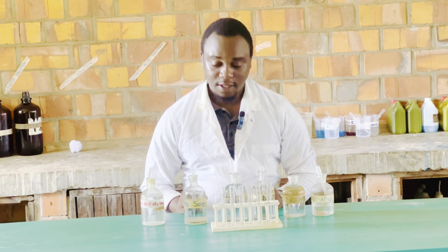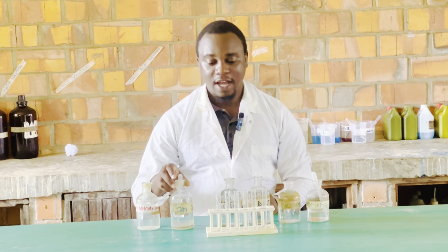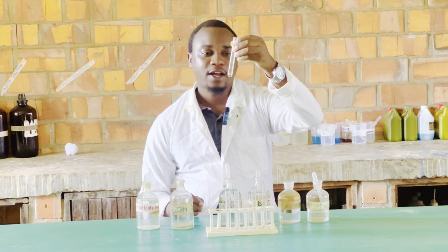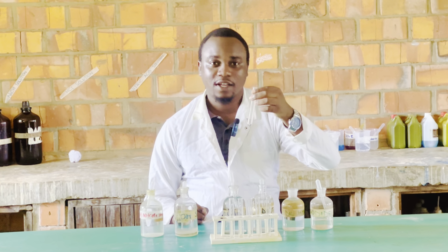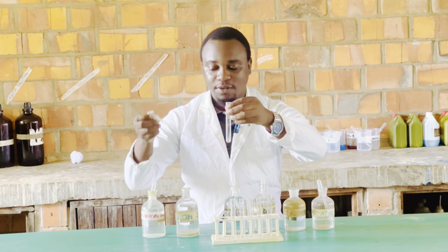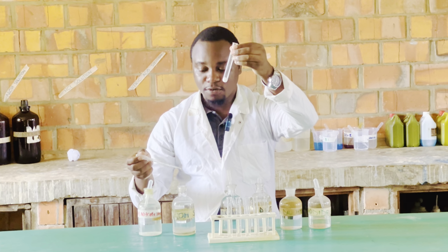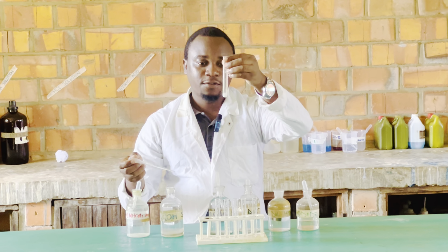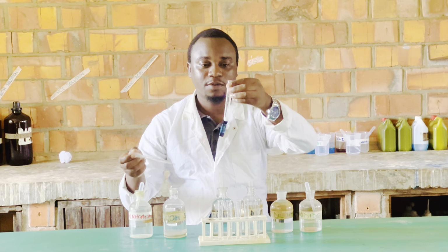So I will start with 2 molar sodium hydroxide solution as the testing reagent. In this test tube, I will add drops of sodium hydroxide and we see what happens. First drop wise, and then we shall see what happens in excess. So here is my sodium hydroxide. When you add just a small drop, we get a white precipitate. That is on addition of a few drops. So in lead ions, when we add sodium hydroxide, we get a white precipitate.